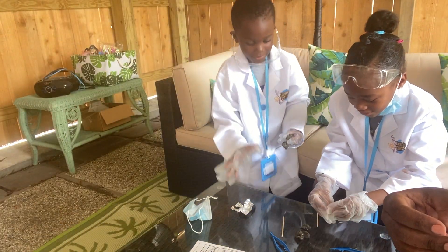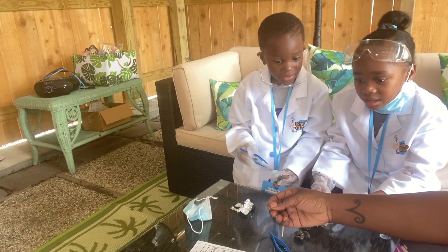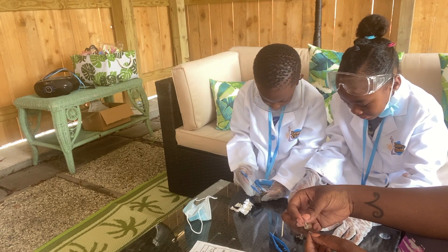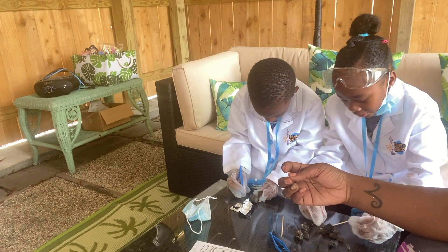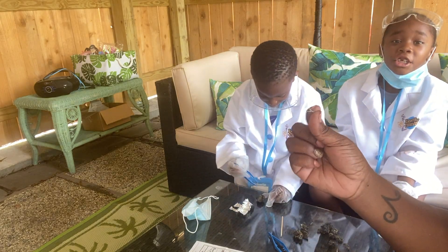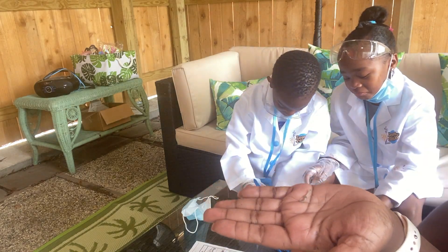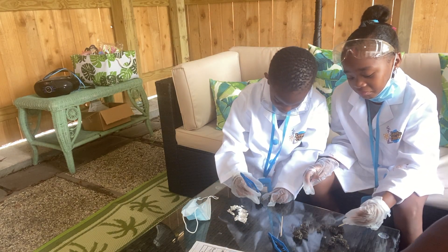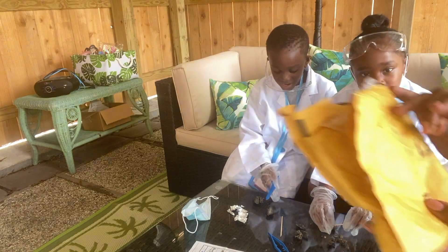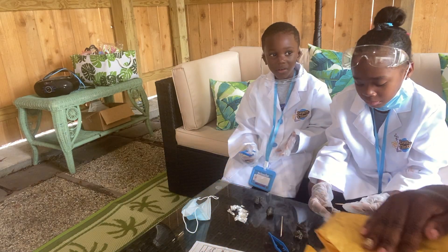So I see little... Look, this looks like a bone. I got a lot of bone. See all the hair from whatever it was — it's all covering it up. Check out this bone. If you're touching a rat, that is disgusting. It's hard to see because it matches my color. Oh look, I broke it up. Don't break the bone.